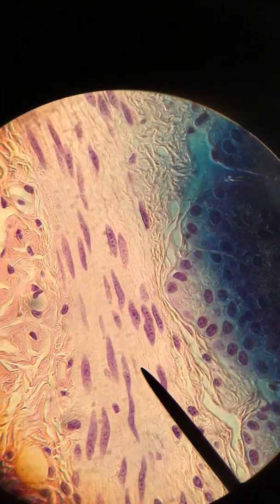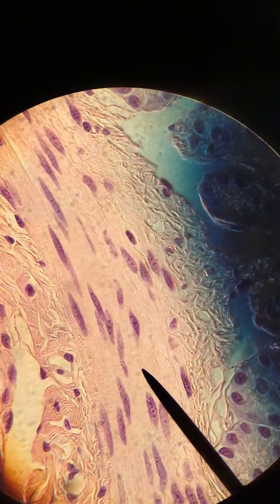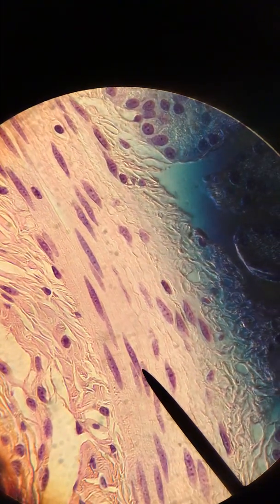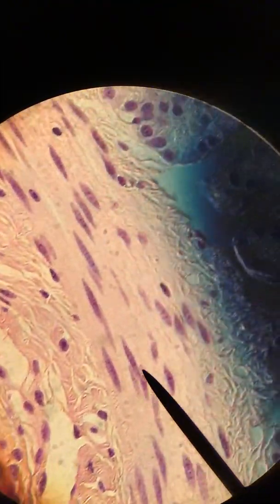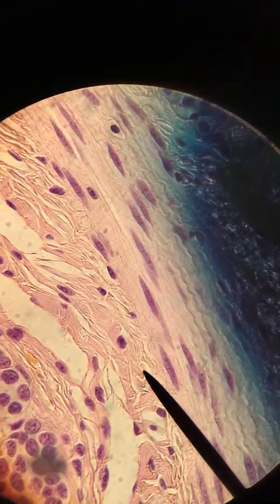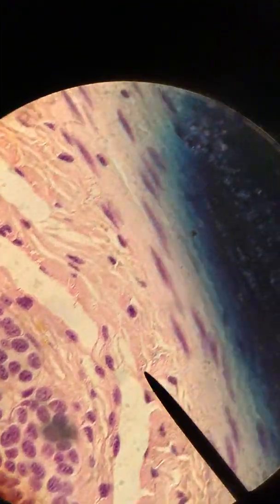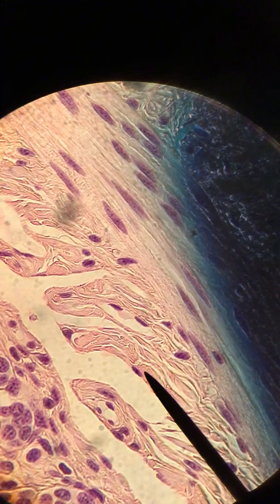You can see the smooth muscle fibers — there are no cross striations, but you do have a pretty prominent elongated nucleus associated with them. If you look closely, you can see there's a nice parallel line to them. In contrast, here we've transitioned into irregular dense connective tissue, and you can see how those fibers run very differently. Morphologically, they look quite different from each other.